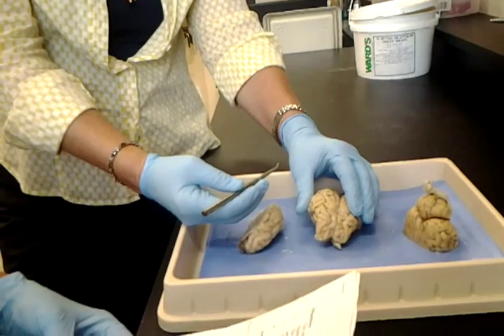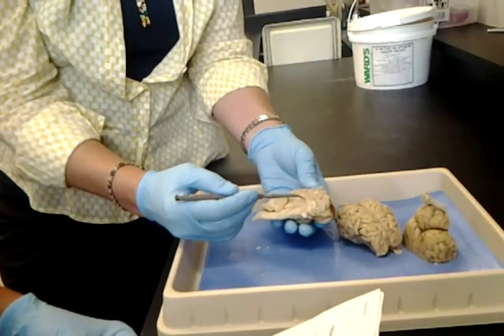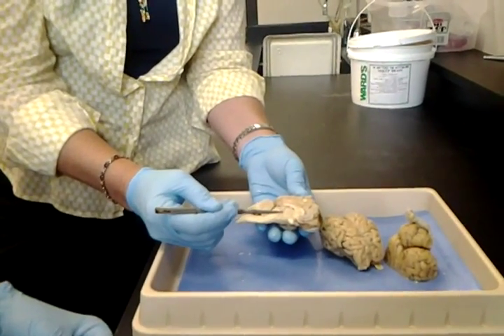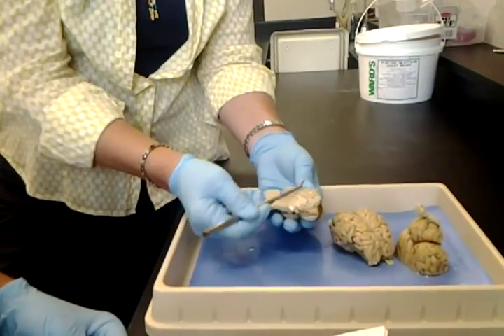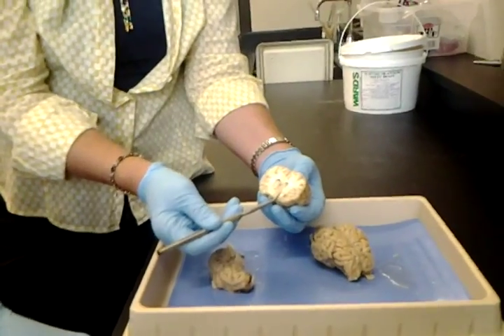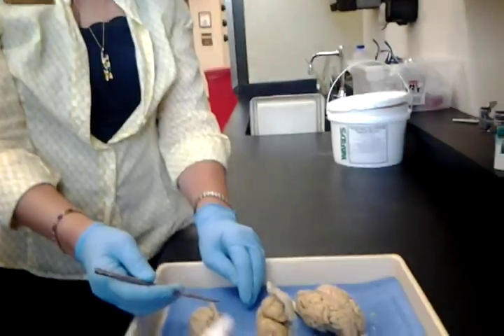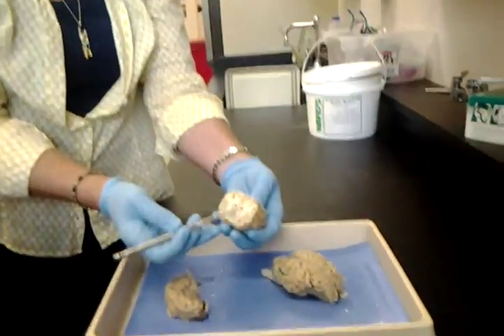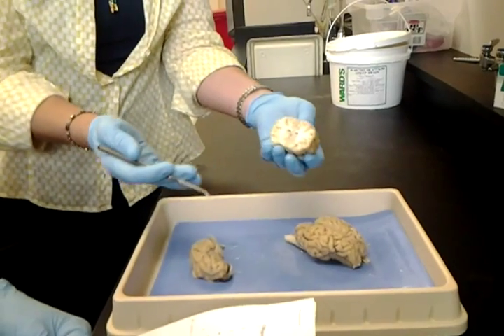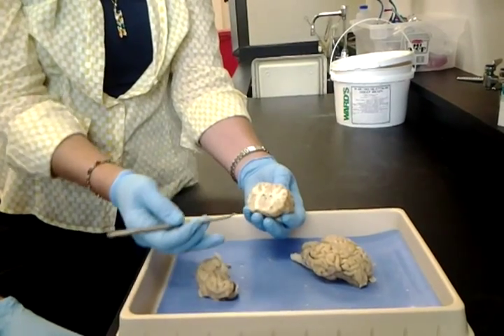Pons, spinal cord, thalamus. Remember, that is deep. We're going to find it underneath the fornix. This was fornix, this is corpus callosum. This round structure here is thalamus. If we cut it this way, a frontal section, go back to this, all this round area is thalamus. Nice and visible there as well. We already did third ventricle. Remember, that's going to be right there above the thalamus, kind of in between it. Remember how I said the thalamus from each side comes together and makes an envelope? That's that envelope, the third ventricle.